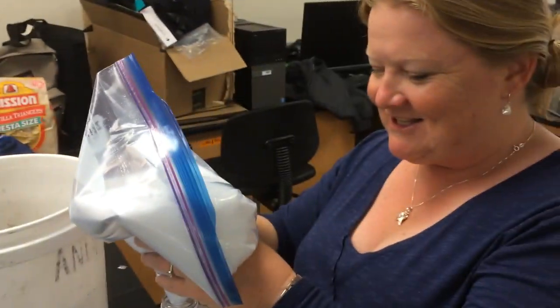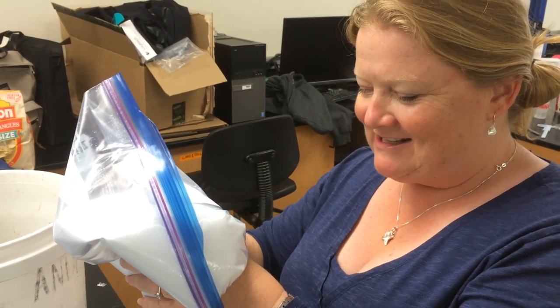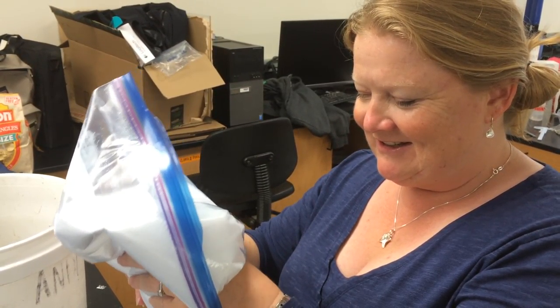This is the low-tech, this is the island, budget glassware solution. Do we know any other way?